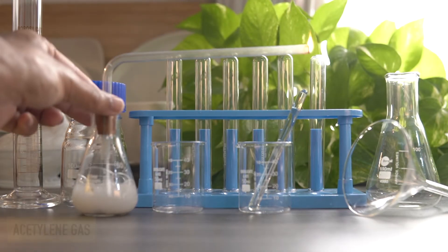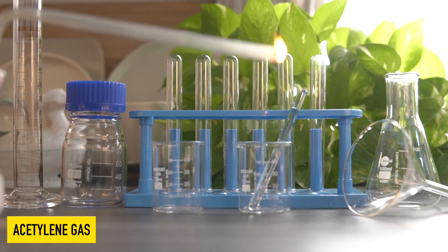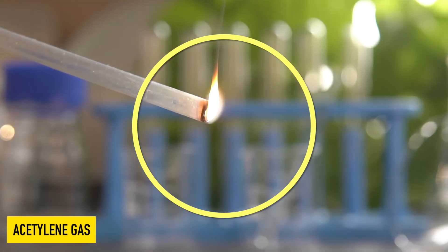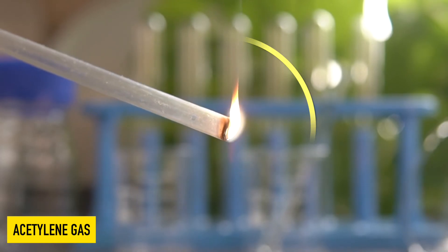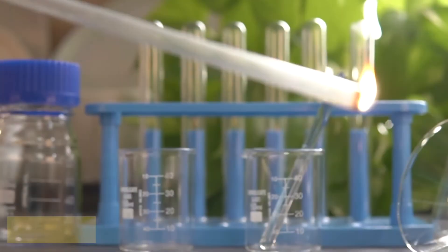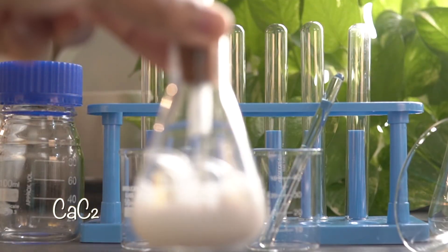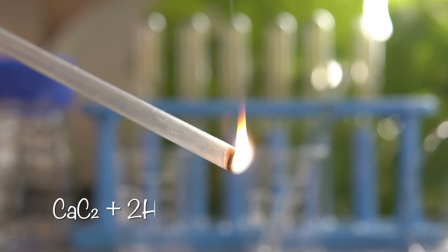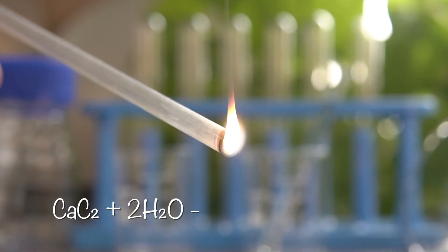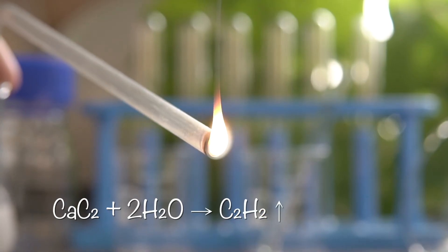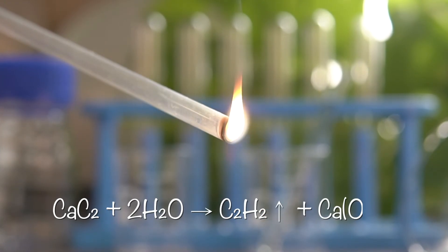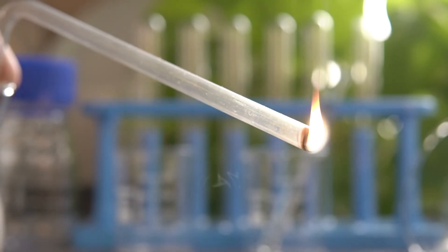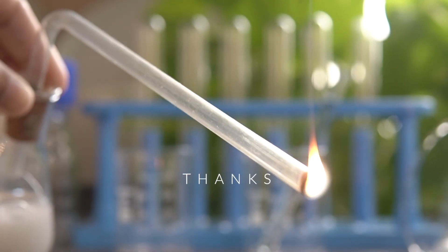This experiment proves that acetylene gas is highly inflammable. So in this reaction, when solid calcium carbide CaC2 reacts with water H2O, it will produce acetylene gas C2H2 along with calcium hydroxide Ca(OH)2. This reaction is called hydrolysis of calcium carbide.